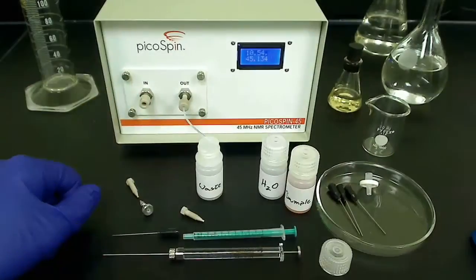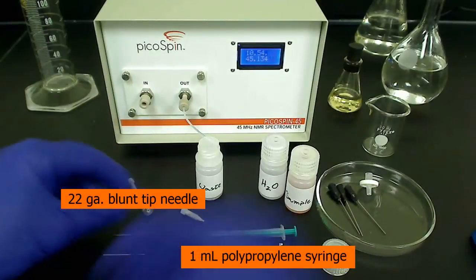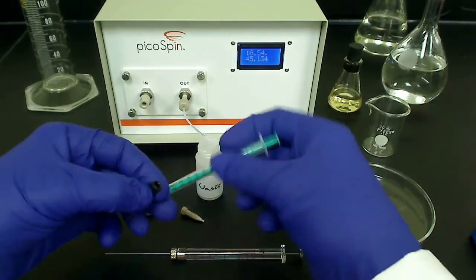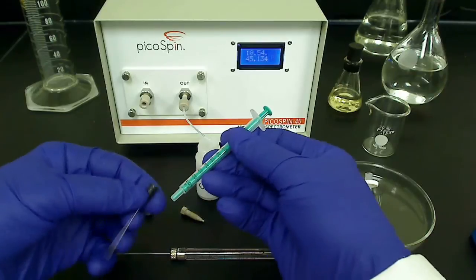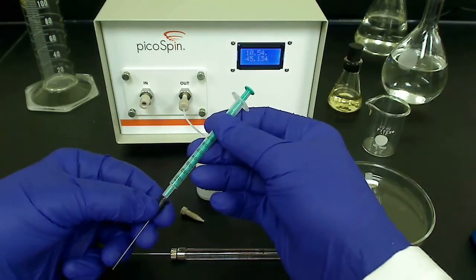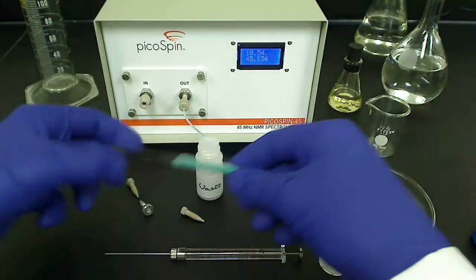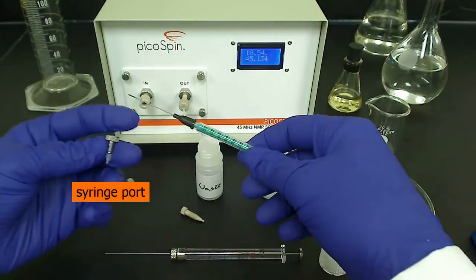When connecting the syringe and needle, make sure you firmly seat the syringe into the luer connector of the needle, and then slip on the syringe port. I usually slip on the syringe port before drawing up a sample, but you can slip it on after your sample has been drawn up into the syringe. Your approach will depend on the nature of the sample and sample container.